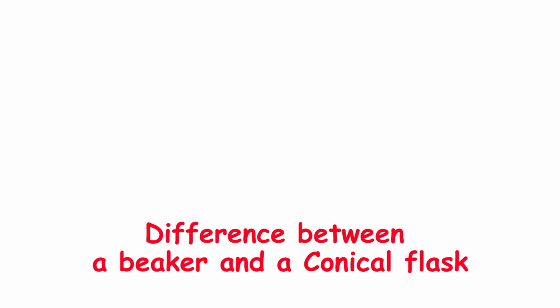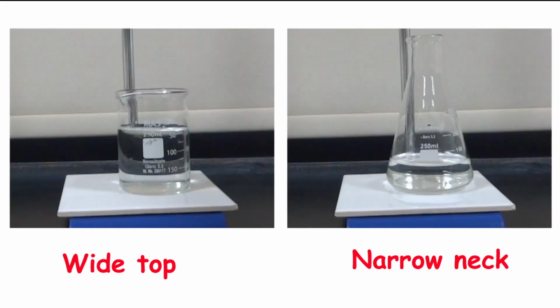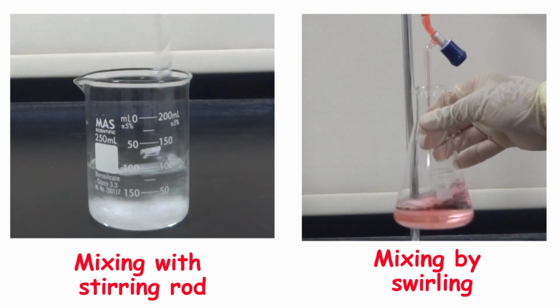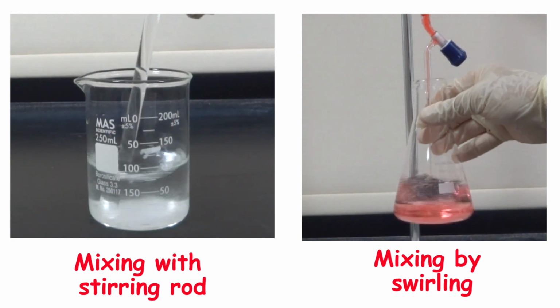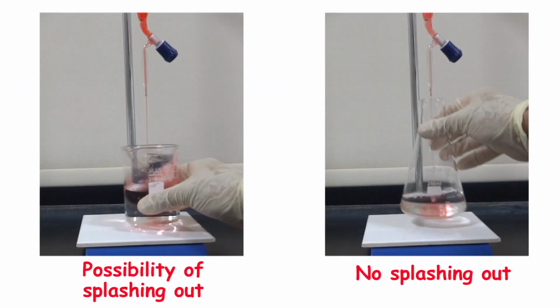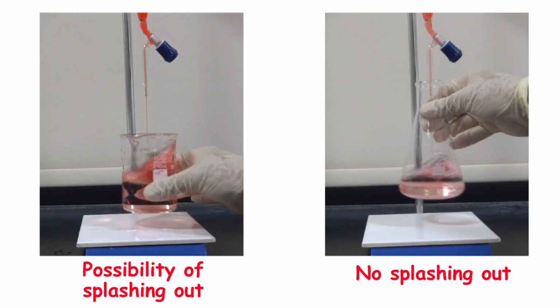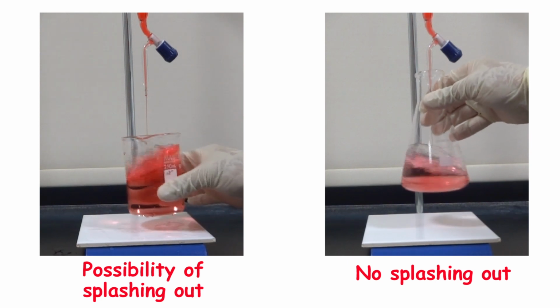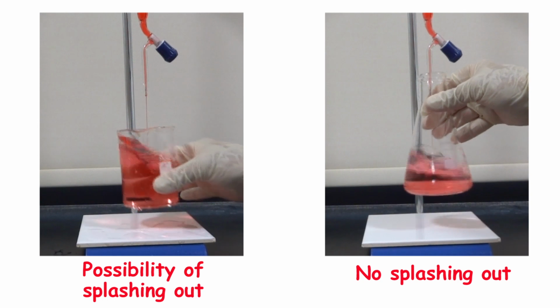Both a beaker and a conical flask are containers. When do we use each? A beaker has a wide top, while the conical flask has a narrow neck. In a beaker, mixing needs a stirring rod, while in a conical flask, mixing will take place by swirling. When we're mixing in a beaker, there's a possibility of splashing out, while there's no splashing out when we're mixing in a conical flask.